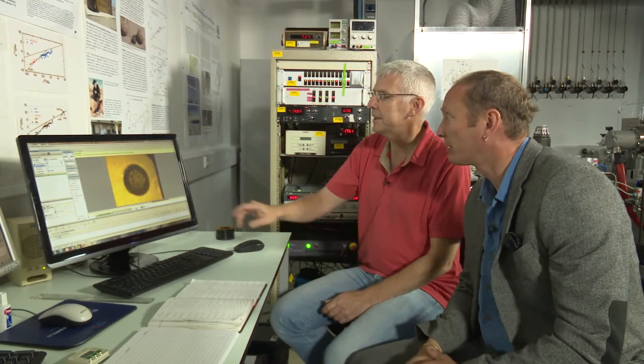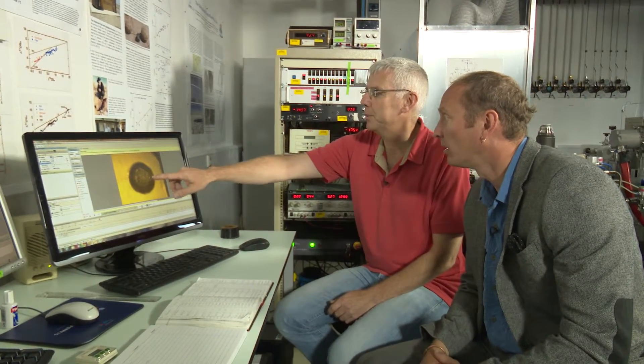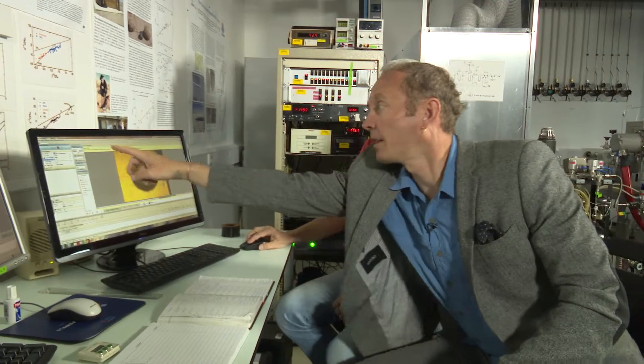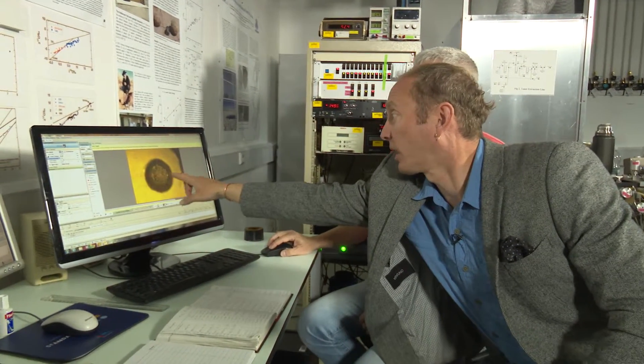So we've got ourselves set up. We've actually closed off the laser behind us. We've closed in on one of the samples. Just how big is this sample ready to be analyzed? So that's a 3mm well that the sample is sitting inside. And is that all ready to go now? That's all ready to go. Laser's powered up. There's reagent in the chamber, so we can go. And so this is actually going to operate the laser behind us. So we're going to fire the laser and have a look at this, look closely at this, because we're actually going to fire a laser at this sample.